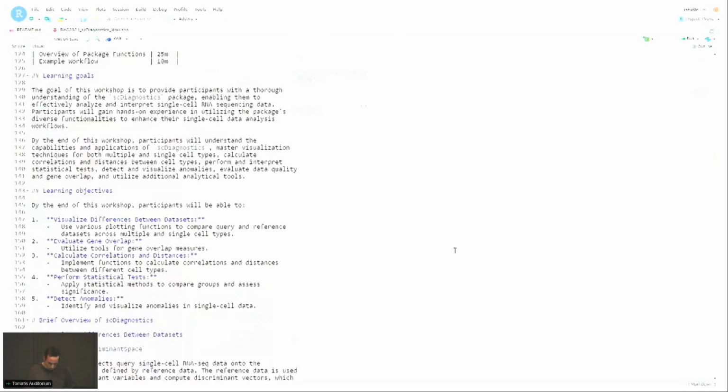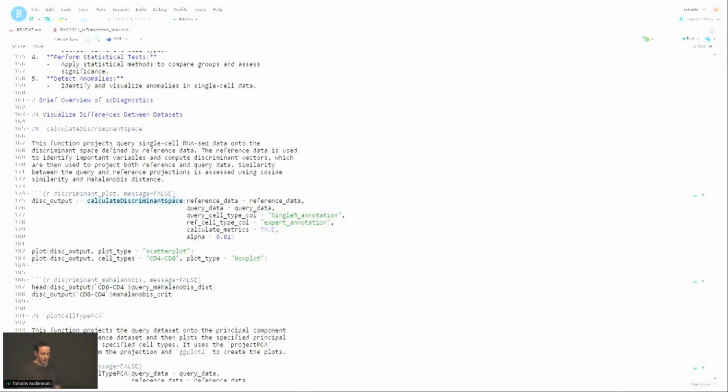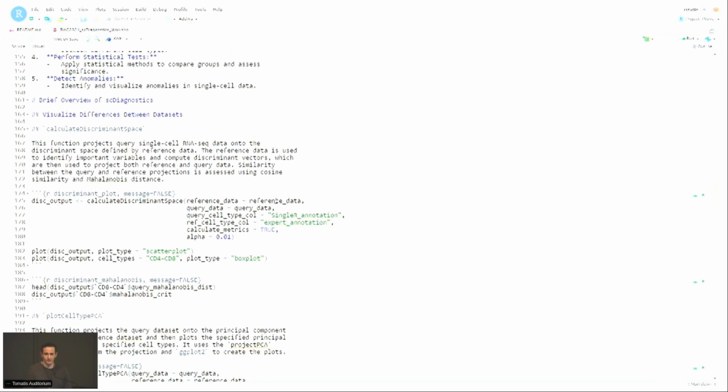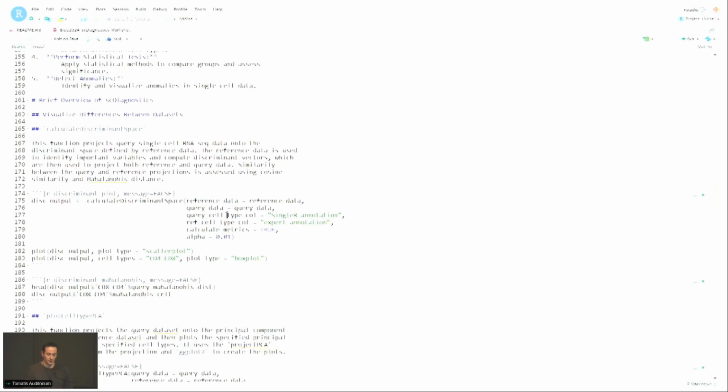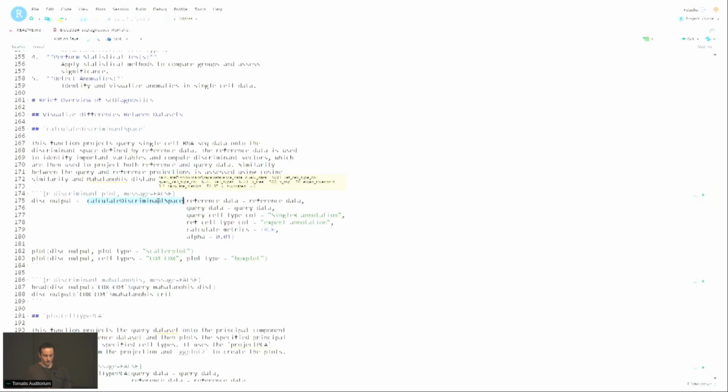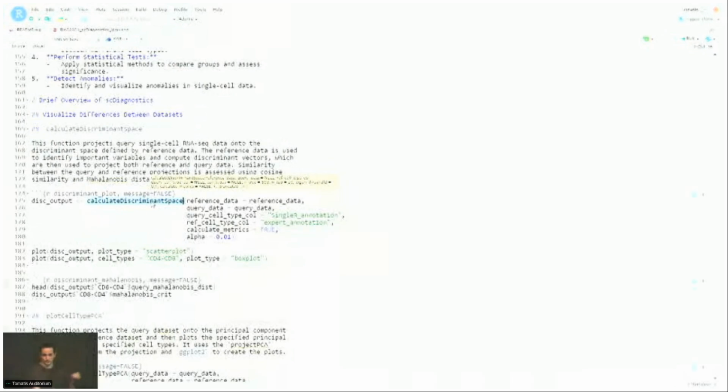In the meantime, I'll go to the discriminant space function. This is the function that computes the discriminant vectors, does all the projections, and gives you a bunch of other diagnostics. For most of the functions the arguments look very similar, except for the arguments that are specific to that function. For example, there's typically a reference data set, which is a single cell experiment object, and then a query data set, which is again also a single cell experiment object. Typically we give the colData column for the annotation of the query and the annotation of the reference. And then there are a bunch of other arguments that are unique to that function. This function also uses some random forest machinery in the back to identify important variables to distinguish cell types. For example, there's an argument called ntree, which is the number of trees used in the random forest.